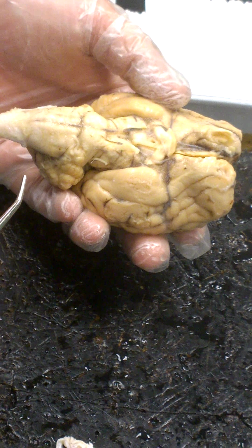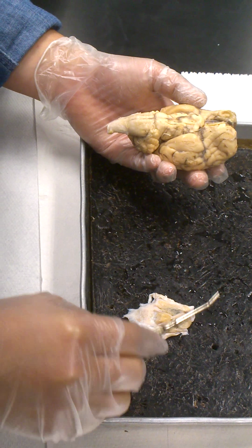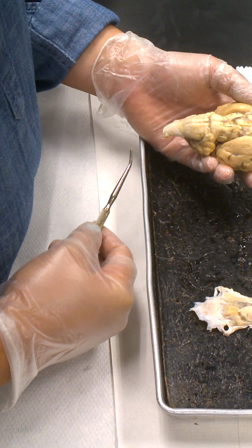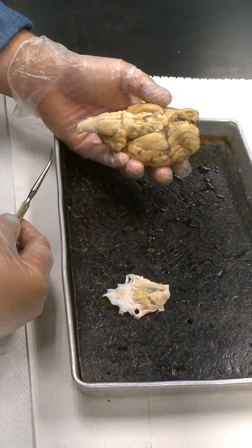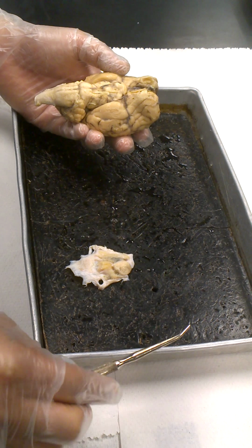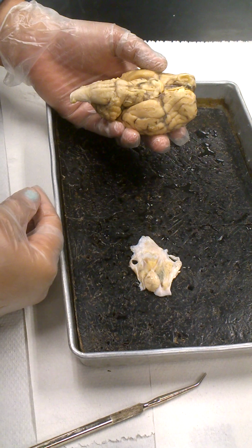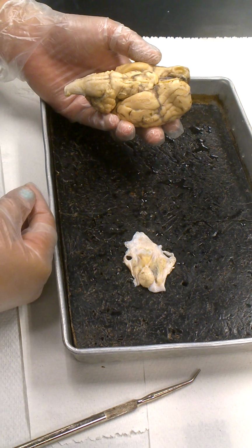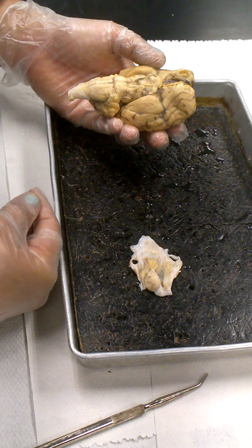All right, guys, so the last thing we're going to talk about is the cranial nerves, okay? So you've got to take your brains and turn them upside down. Now, the brain she's going to show you was done by a student that did it pretty well, meaning that they removed that membrane that has the pituitary while still keeping the cranial nerves that once anchored that membrane to the brain intact. So the cranial nerves you can see on the video versus what you have are short little stubs. The ones you're going to see on the video are nice, they're really long and luxurious, right?